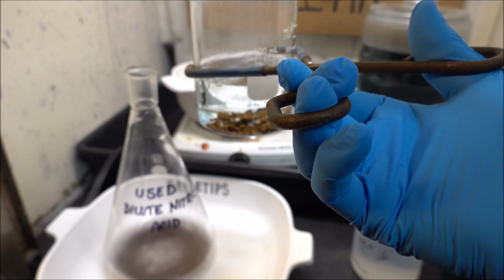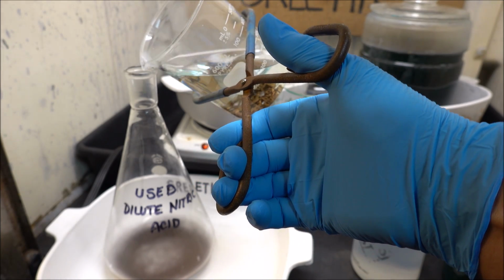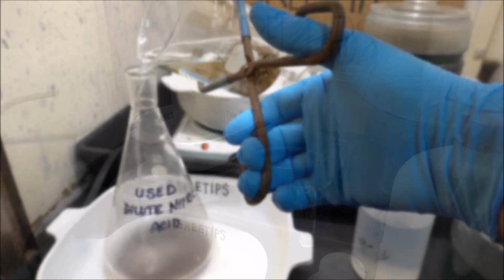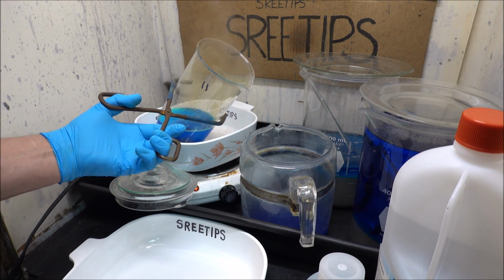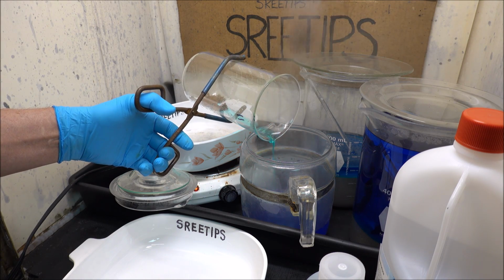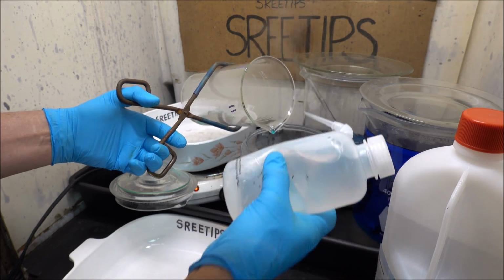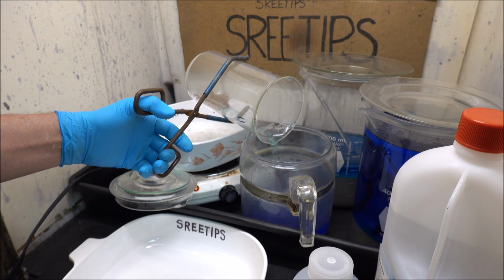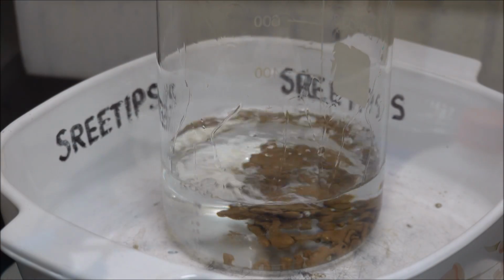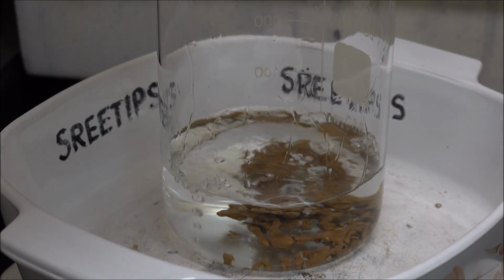These next 3 clips are from previous videos where I inquarted gold with silver and then used hot dilute nitric acid to extract the base metals and silver. Notice how the gold holds together and allows me to quickly and easily pour off those hot dilute nitric solutions. This is how the gold should look when we add the proper amount of silver for the inquartation.